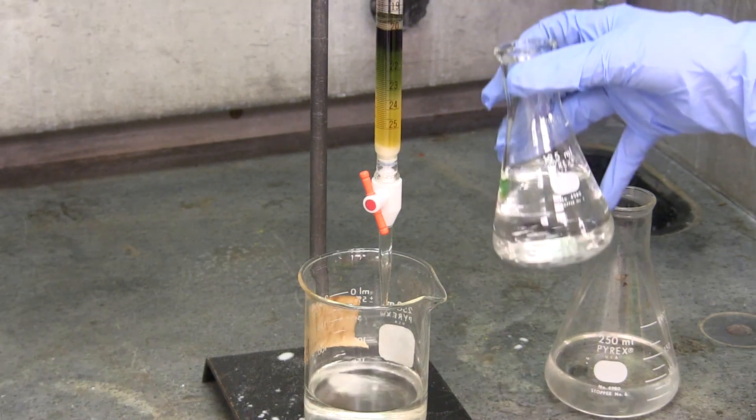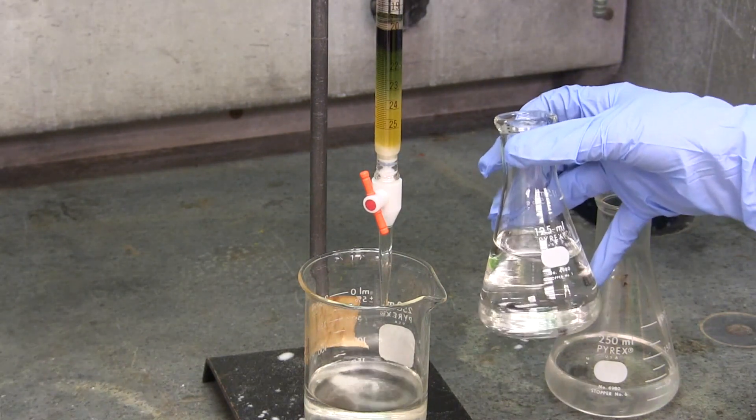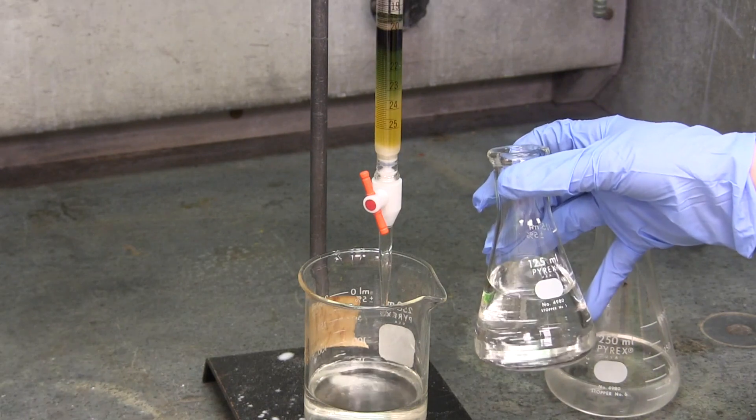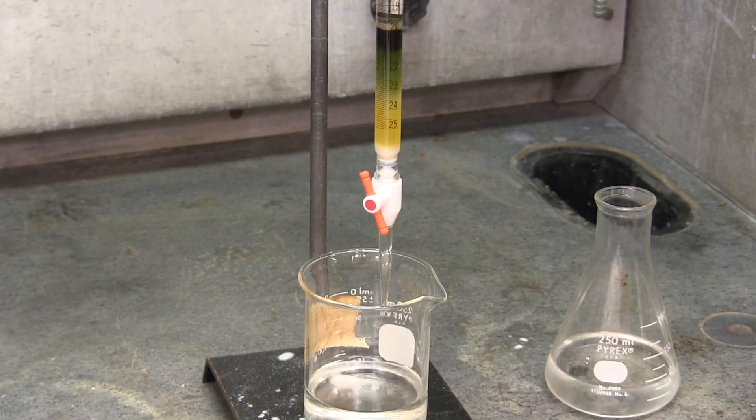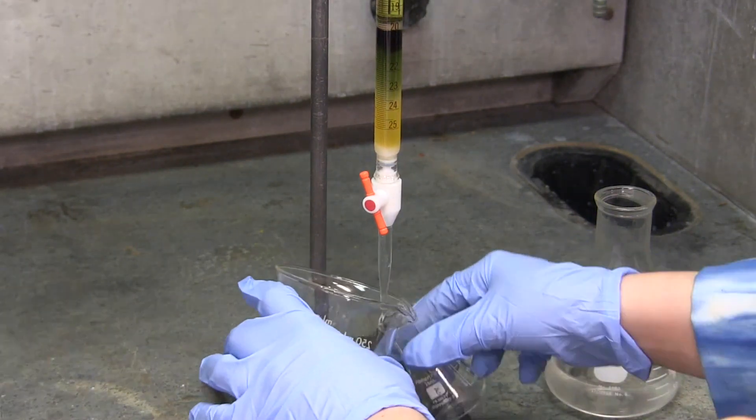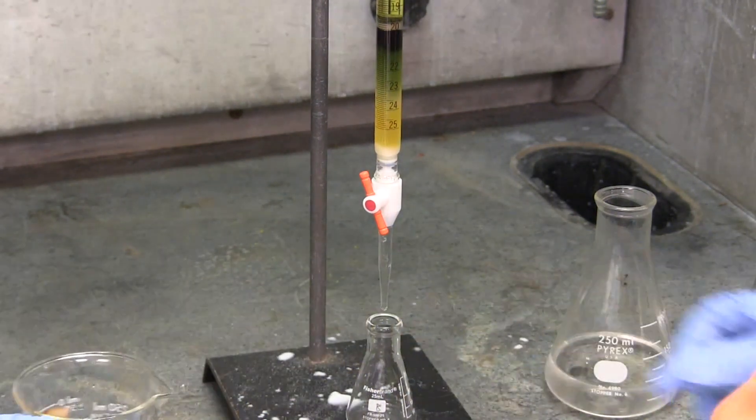In the case for this demonstration, the other solvent is 70% hexanes and 30% acetone. In lab, you may make other solvent mixes that continue to increase in polarity. By switching to a more polar solvent, we will start to elute the polar compounds from the sample. Acetone is more polar than the silica, allowing the polar compounds to be attracted to the acetone rather than the silica column.